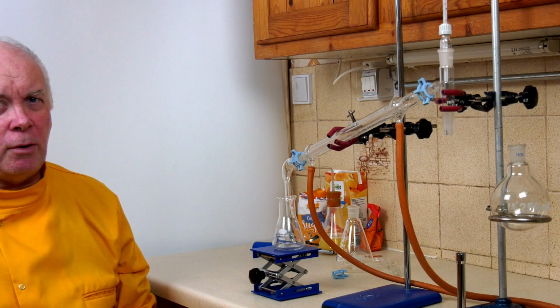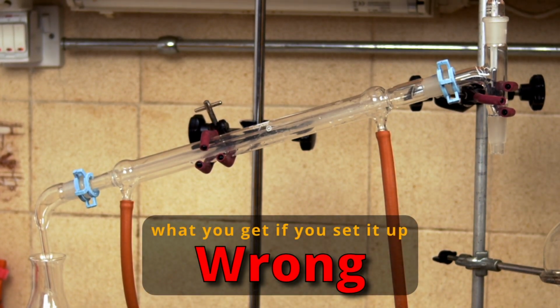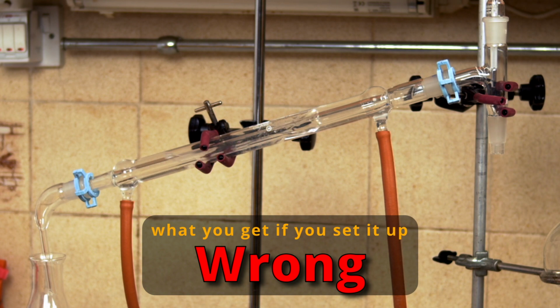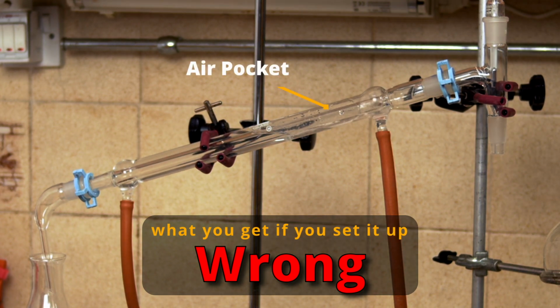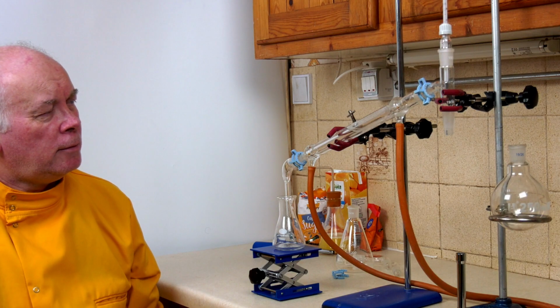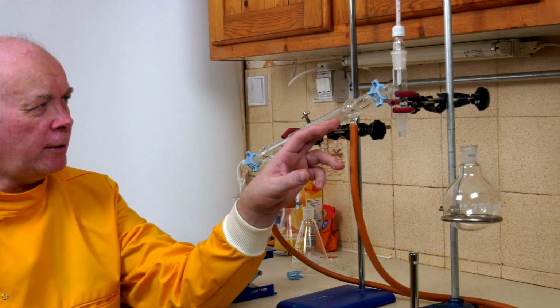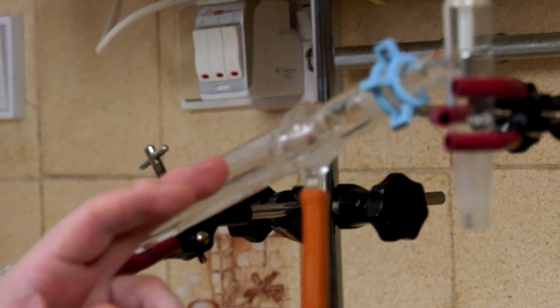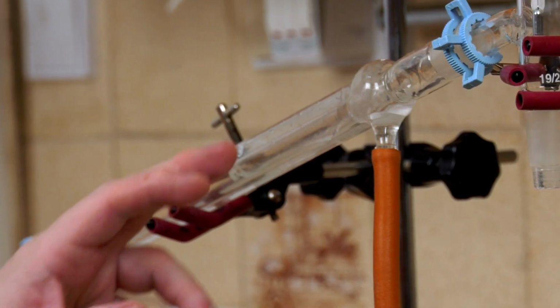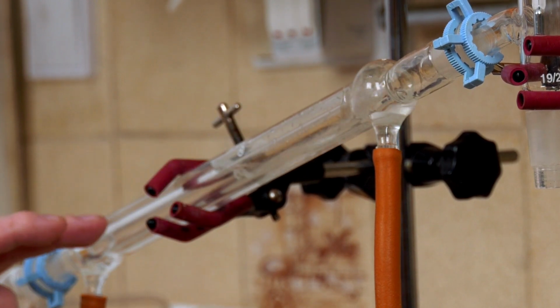So let's turn the water on. That's enough. Good. I'll do. Leave it. Oh, you switched it off. There we are. Now we've got the water running. The water comes up here, but I've managed to get an air gap up here, and this bit of the tube won't be cooled properly. This bit will, but that bit won't. So this isn't going to work.